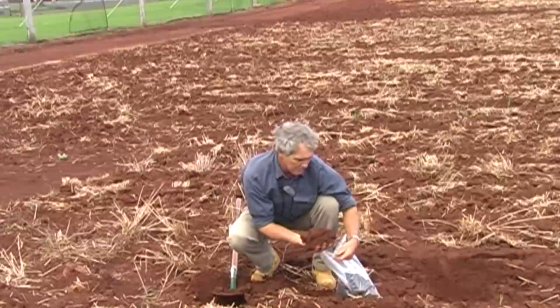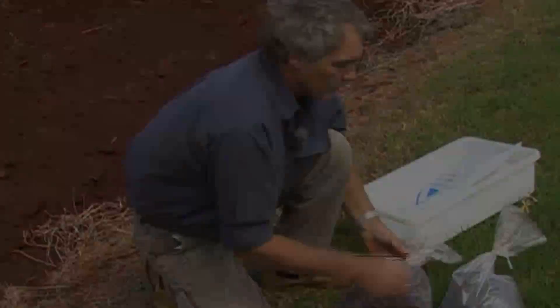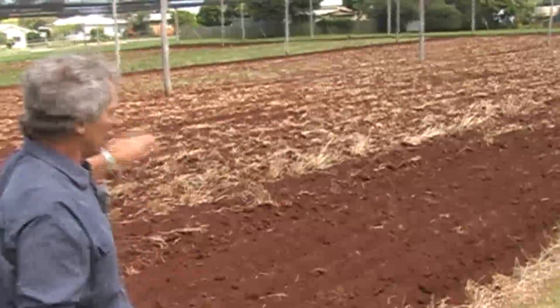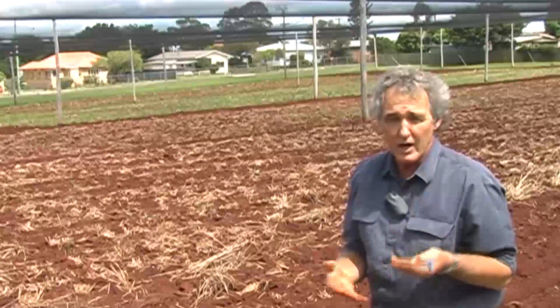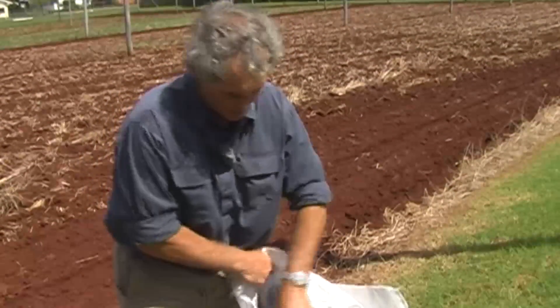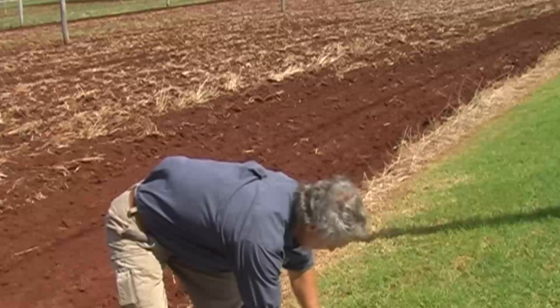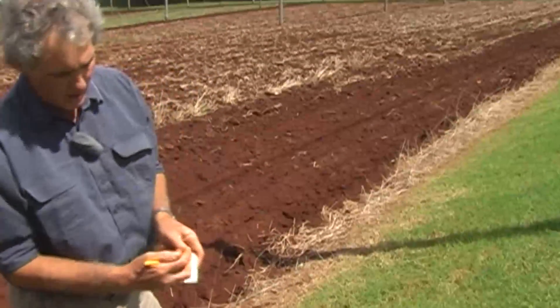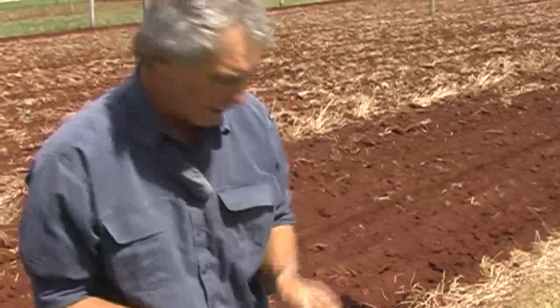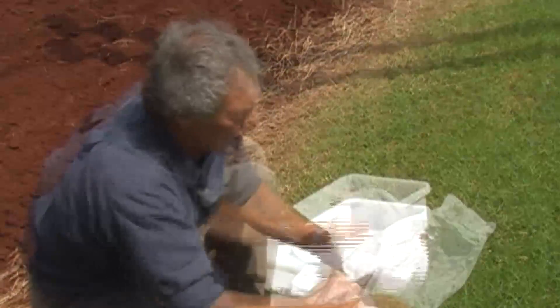You really need about 500 grams I suppose, but that there is probably a really good sample of the paddock. That's sample A. Now in a paddock like this we should be sampling perhaps here, but then right down the bottom and right over the far side. So we've ended up with samples A, B and C. We've collected our soil samples. A fertiliser bag or poly bags — pretty good way to pack them in there — just with a label around the top. Paddock name, details, your name, just to identify it all. And just tie the bag up. That's your sample.